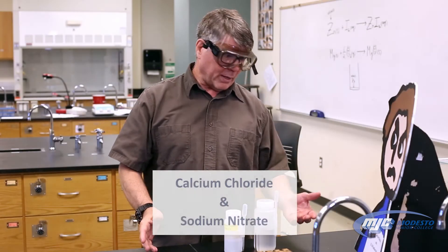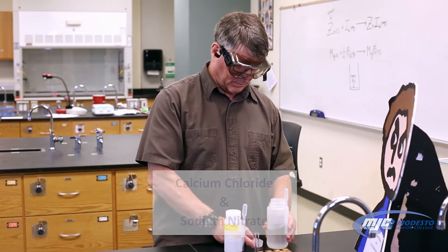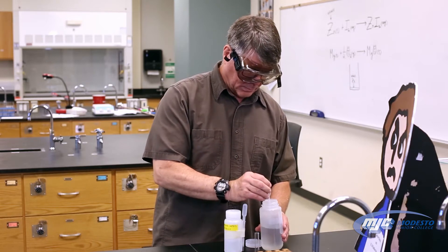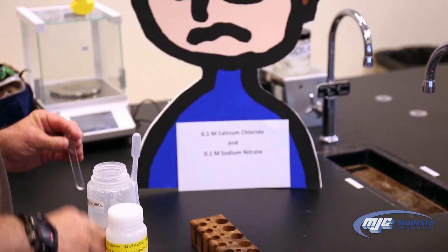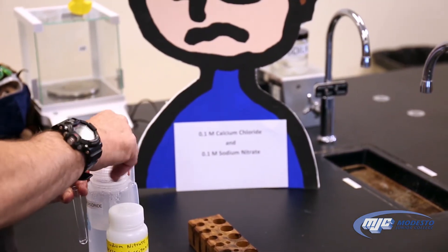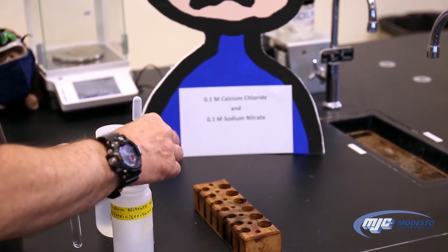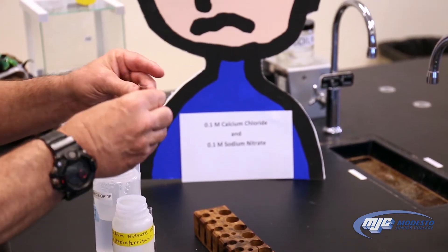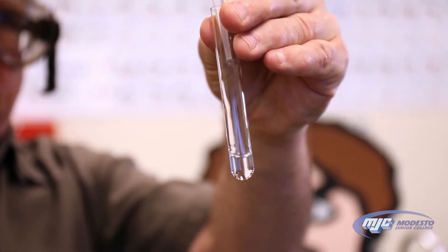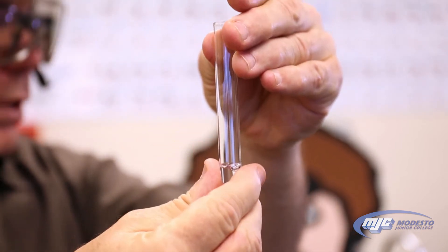This is the reaction, if any, between calcium chloride and sodium nitrate. As always, put the lids back on the containers. No temperature change.